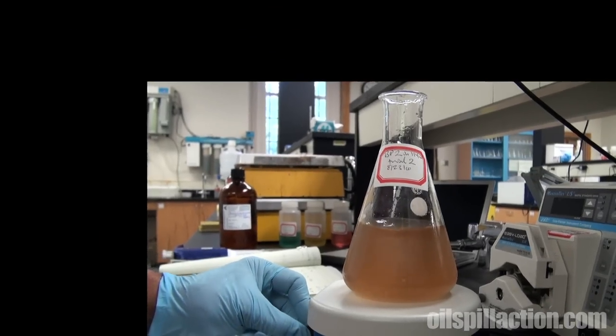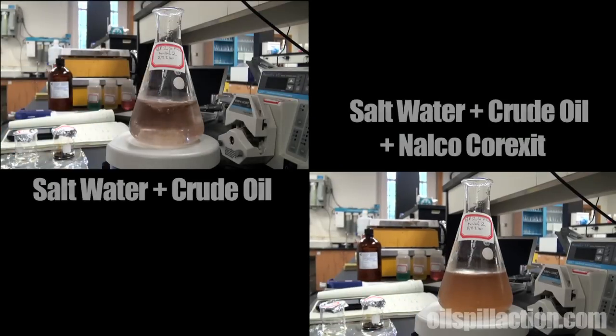Now like before, we've let it stir for about half a minute. We'll stop the stirrer bar, and we'll see if we notice anything different.